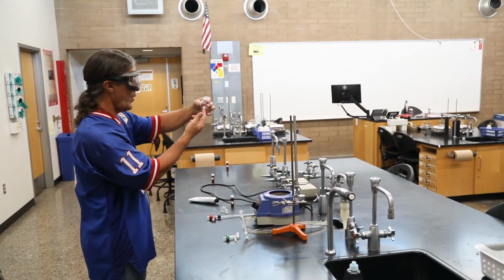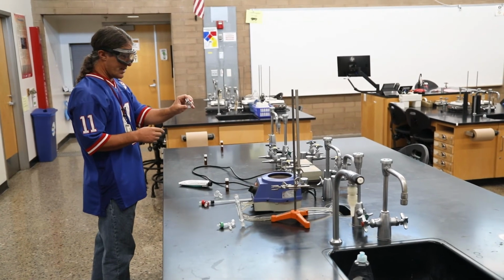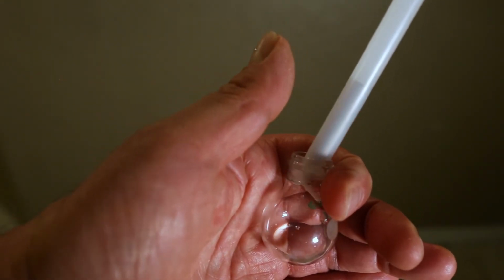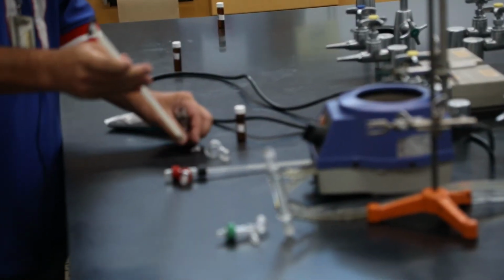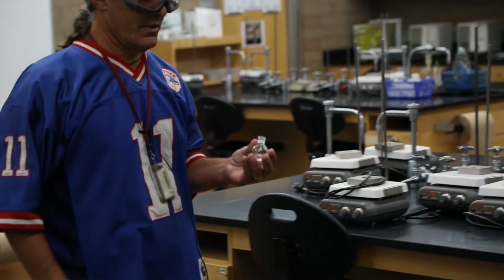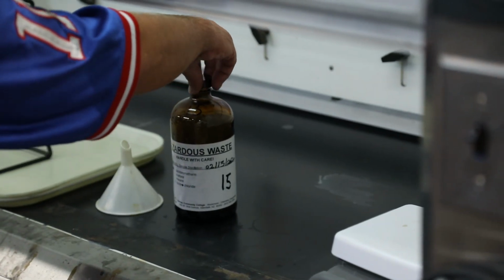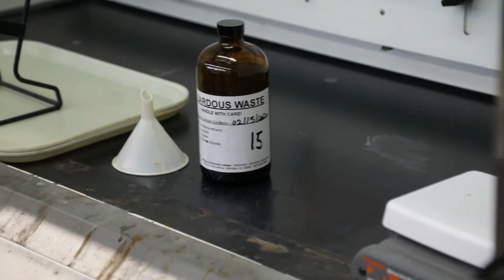I'm going to also pour this in the waste, making sure not to dump the stir vane into the waste if possible. So a lot of times we might want to use a magnet to take the stir vane out of the flask. So I have this nice handy retriever tool. I can suck the stir vane out of the flask, and that way I'm not in danger of throwing the stir vane into the waste with the waste. And there goes the waste. Again, some people might say, oh, let's put this back in the hexane bottle, but that's just not the way we do things. And you notice there is a little bit of solid residue in the flask.